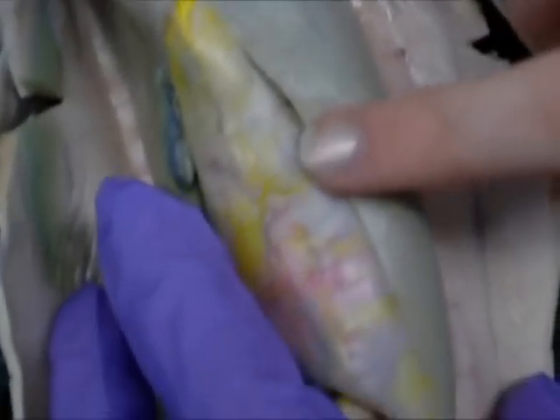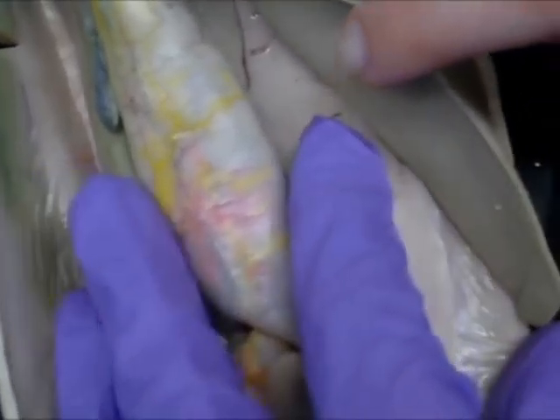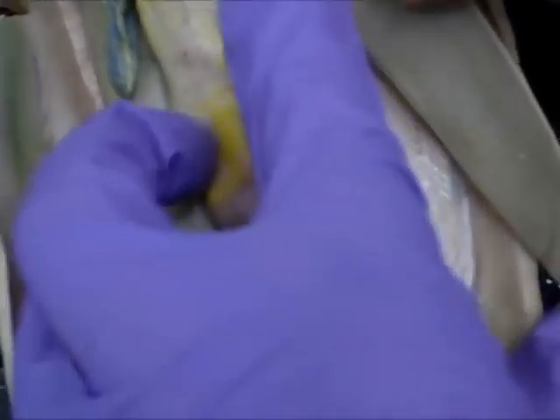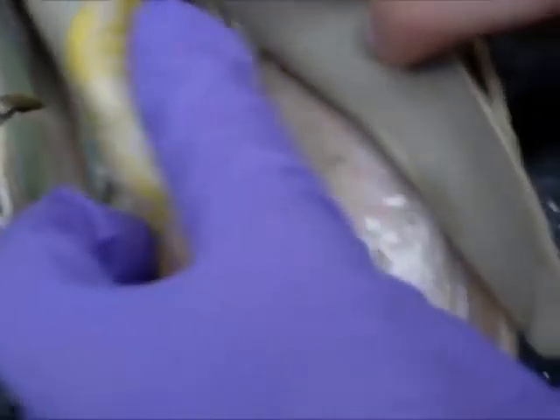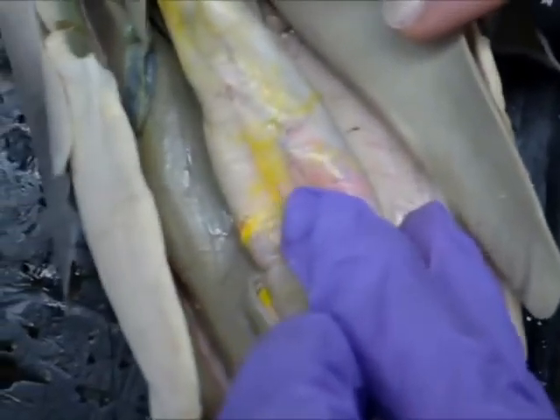There's the liver. It's huge. And underneath the liver we have the esophagus going into the stomach, which is full.